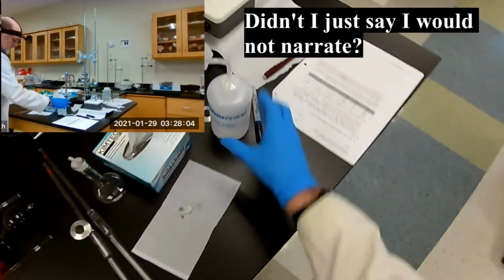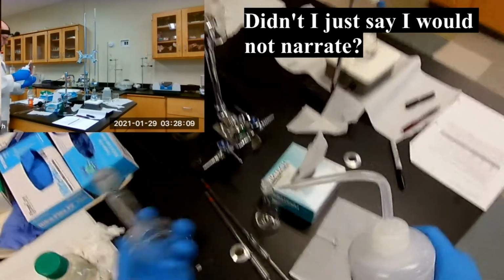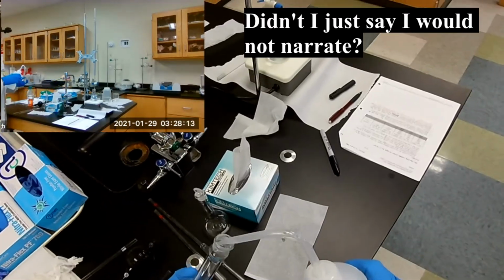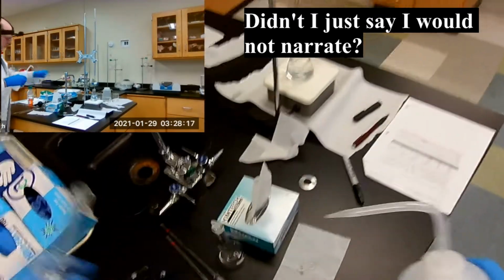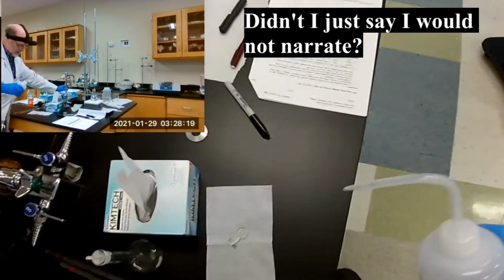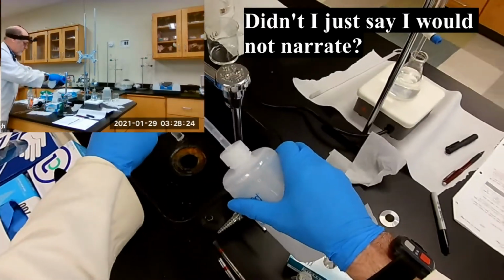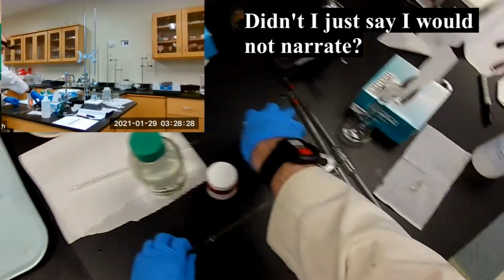We can reuse this one, but we do have to rinse it out. There's not enough ammonia or silver in there to be of concern. So that goes down the drain. And we need to clean off the stopper. There we go.